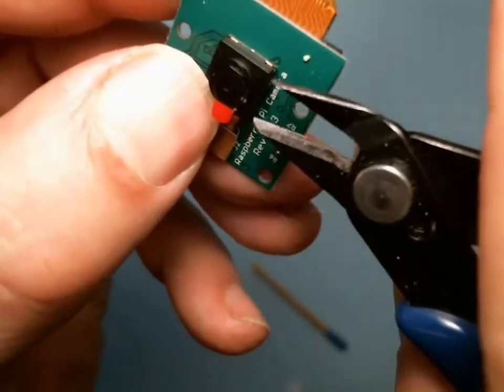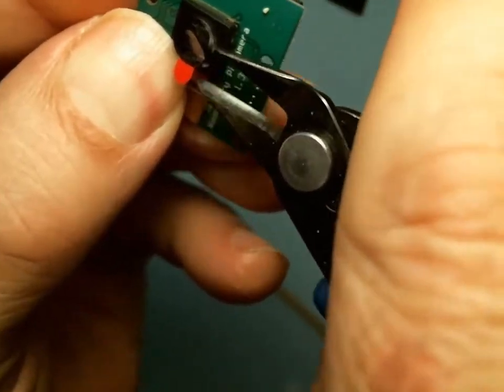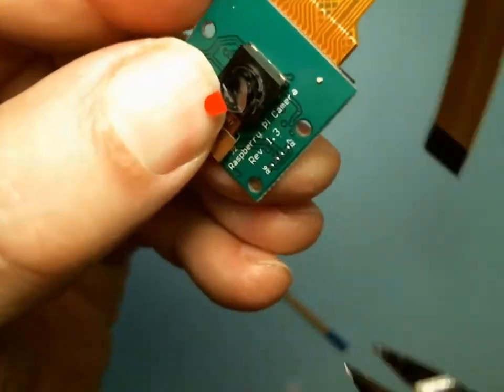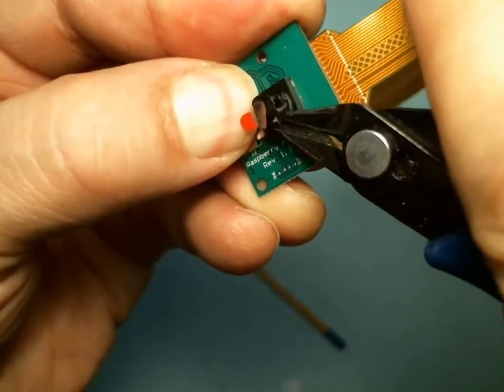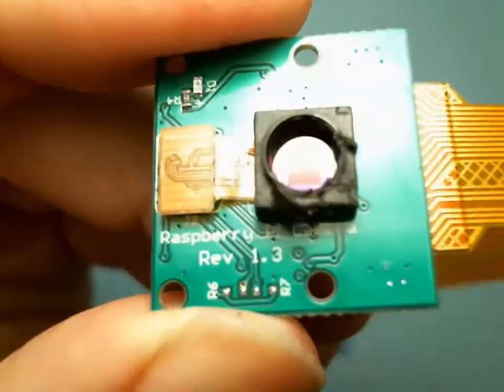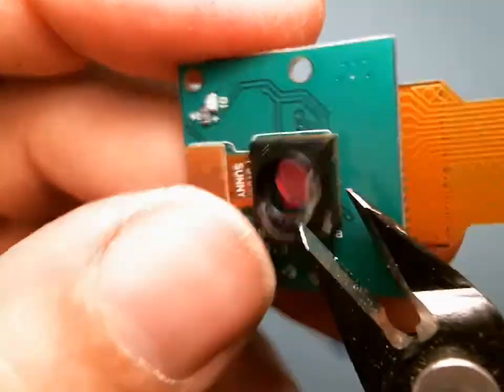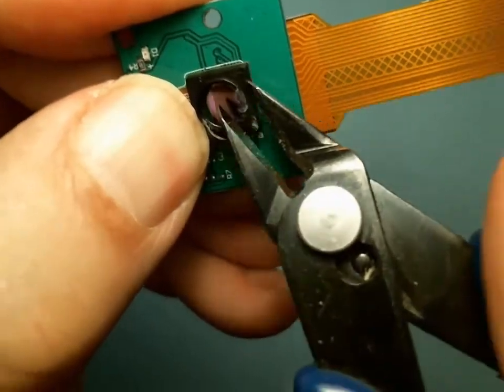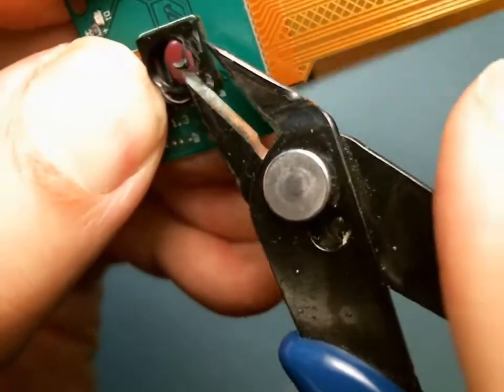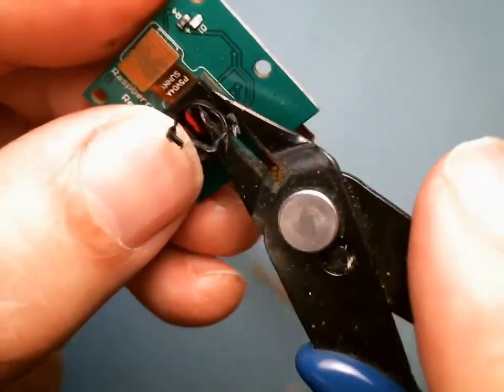Push the camera against here and just start nibbling on the lens. I can feel it popping up. It's coming out. The lens just popped off — it fell right on the image chip. The most important thing is not to let these sharp diagonal cutters touch the glass in there; if you do you'll permanently scratch it. Now I'm just going to nibble away at the corner. The key is little, little bites. I got one corner off — I'm going to nibble on the side.